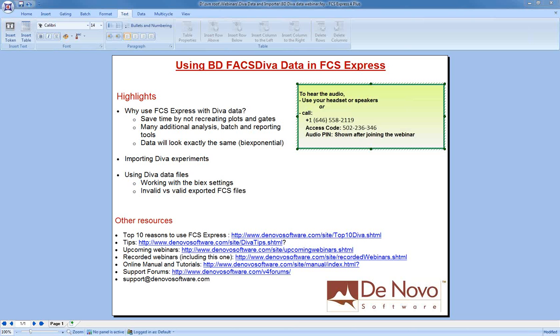Today I'm not going to discuss the details of FCS Express in terms of reporting or in terms of gating details. What I am going to cover is how you can save time to get set up into FCS Express. So once you've chosen to use a third-party software, you can save time by importing your entire analysis from Diva into FCS Express. This will recreate all of the plots and gates for you so that you don't have to again.